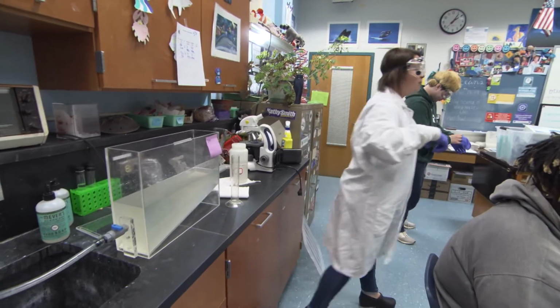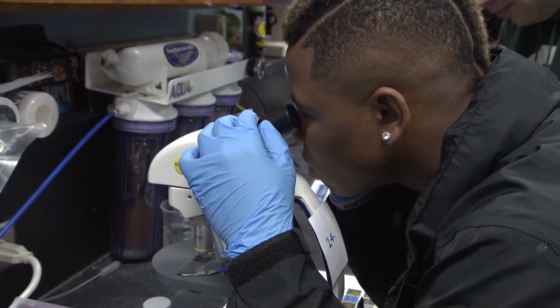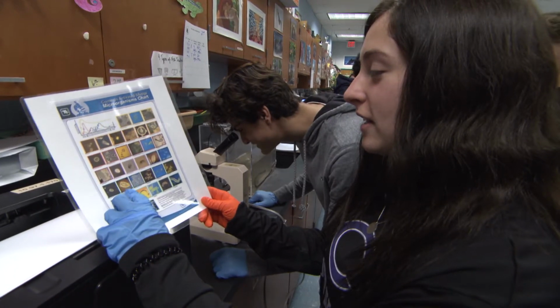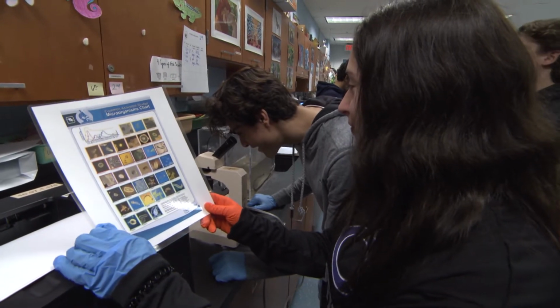while waiting. The students will watch a video on microorganisms and review and identify microorganisms under the microscope. This activity will give students a chance to improve their microscopy skills and develop a better understanding of microorganisms and what their roles are in helping to clean our environment.